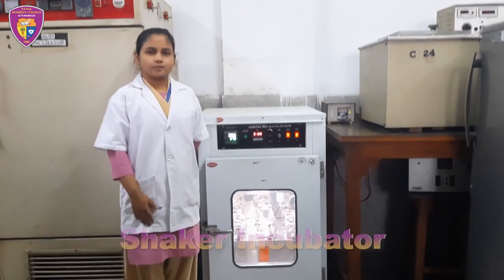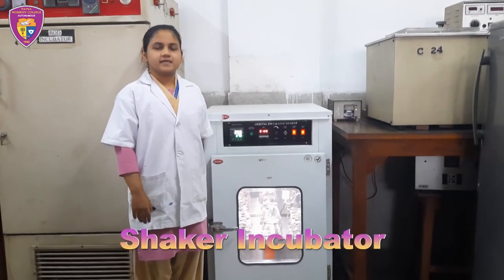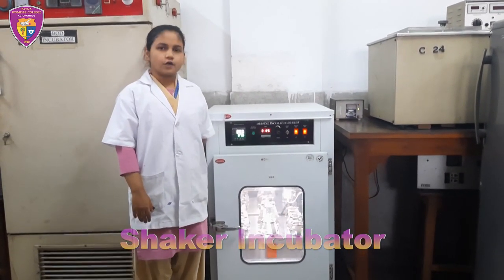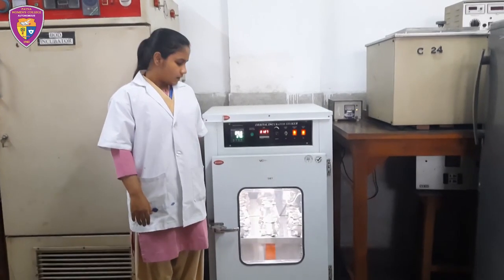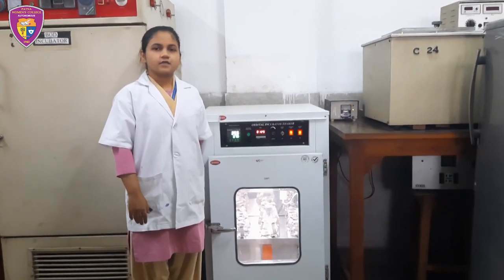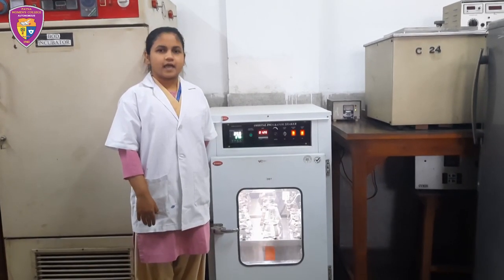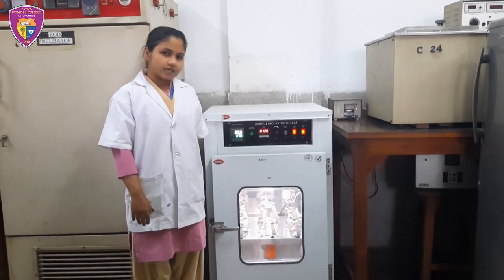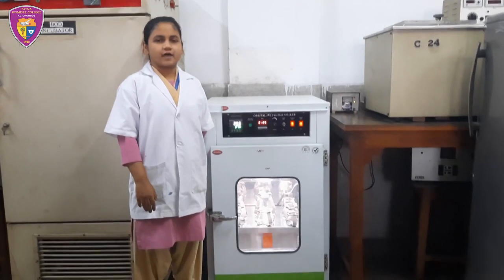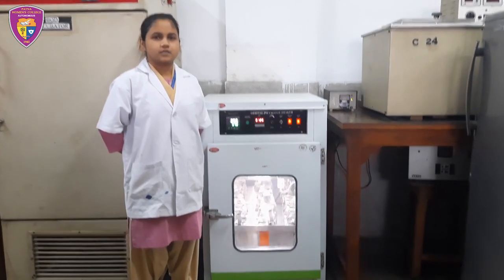This is a shaker incubator. It is used to blend, mix or agitate substances in a flask or tubes by shaking them. It is useful for microbial growth as it provides optimal temperature and RPM while shaking substances to provide nutrients and oxygen for even distribution in the culture.